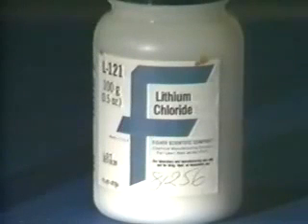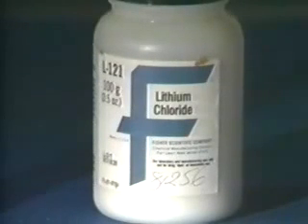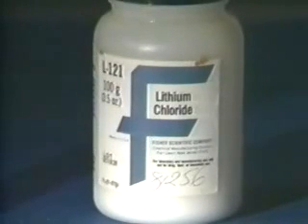In this experiment, we are going to look at the characteristic colors given to flames by alkali metal compounds. The first flame is the red flame caused by lithium. Lithium chloride on a platinum wire gives a red flame when inserted into a Bunsen burner flame.